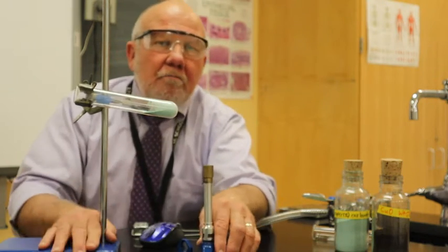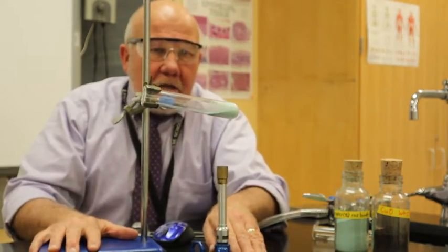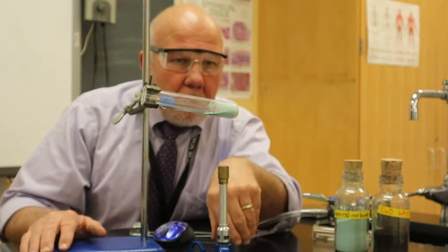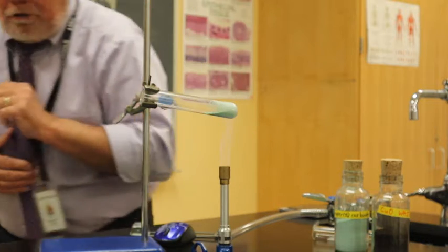And what I want to do is bring my test tube, which I've already clamped in place here. I've got it sideways. I've got it over here so that the flame will be over here. All right, so as I'm heating that, it will get hotter over here, but not over here. All right, let me see if I can zoom in. All right, so let me get a little bit closer look at that.